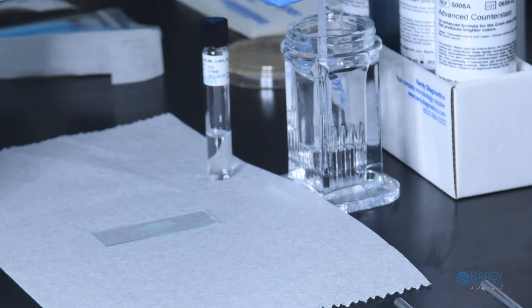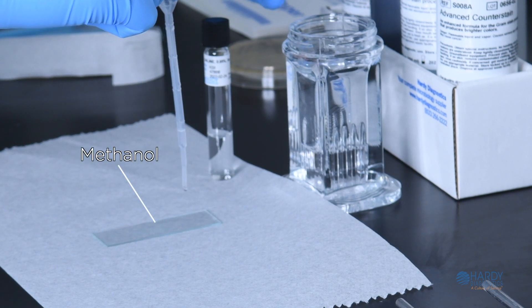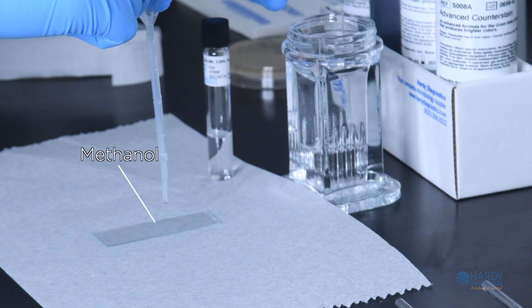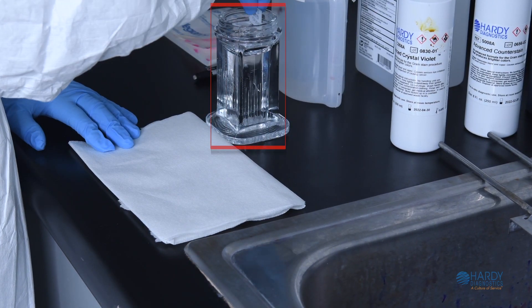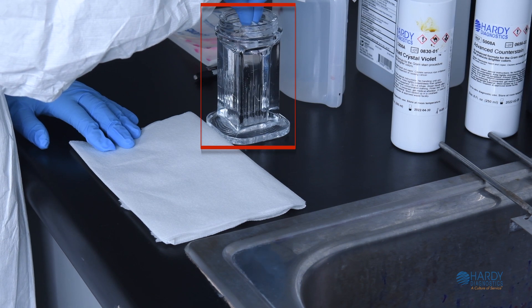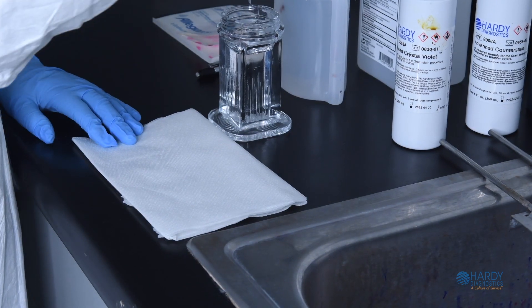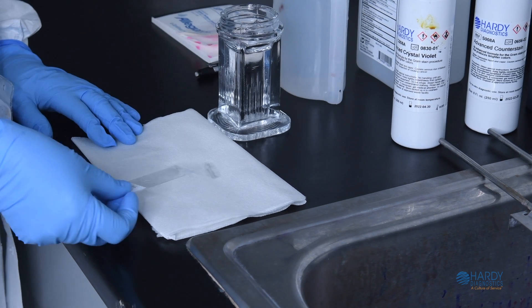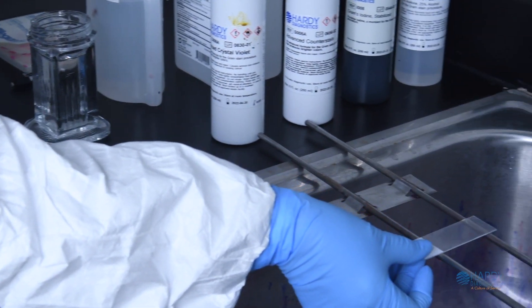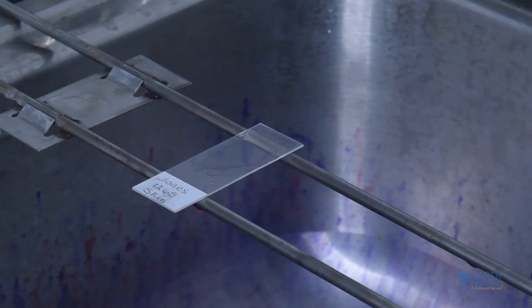Place or hold the slide over a paper towel and flood the slide with absolute methanol for two minutes. Alternatively, you may dip the slide into a Coplin jar filled with methanol. Once two minutes have passed, tilt the slide and drain off the excess methanol and let the slide air dry. Do not wipe or blot the slide, as this can remove cells.